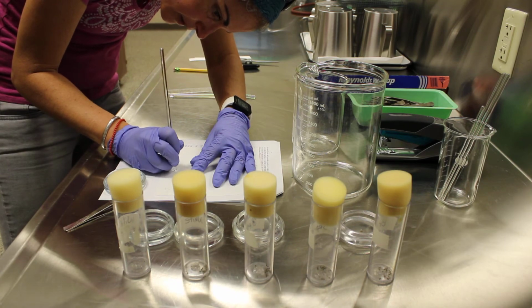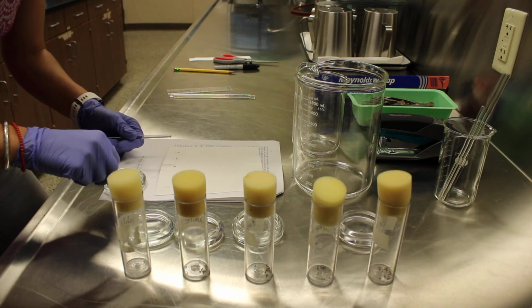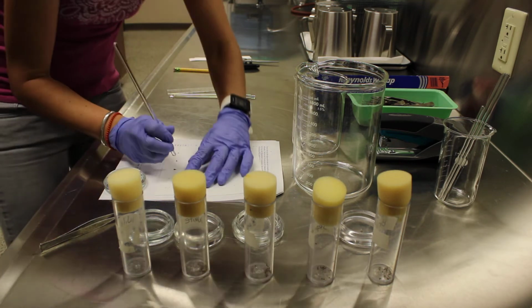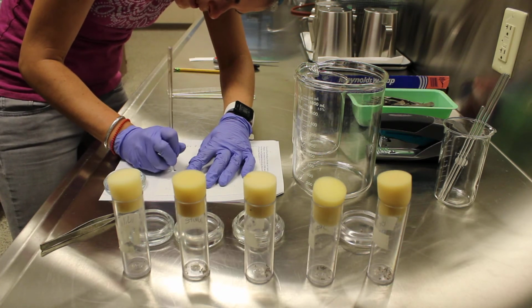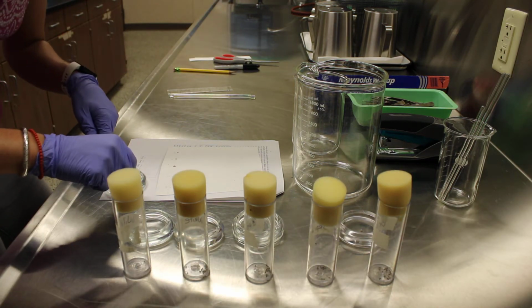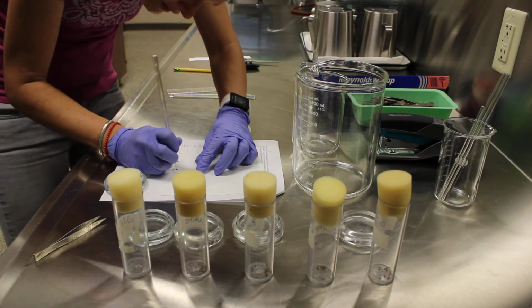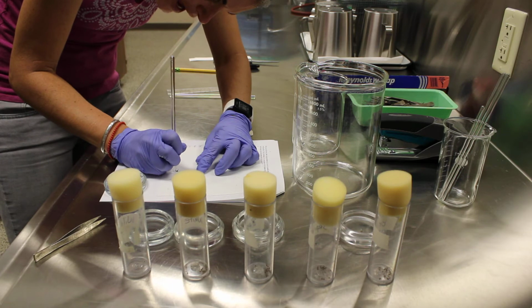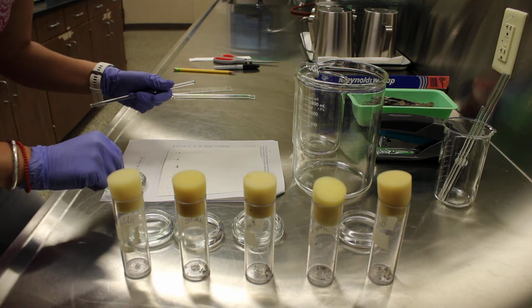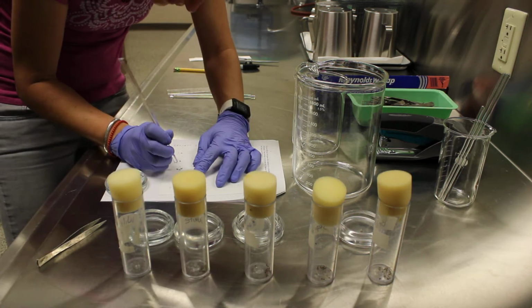Just trying to get a bunch of this eye pigment on this spot. And then just like we did with the plant pigments, we'll use a chromatography solvent to try to separate out the different molecular components of the eye pigments. We'll see which of these flies has or does not have certain pigments. We'll do 1 more of these guys, and then we'll move on to the rosy.